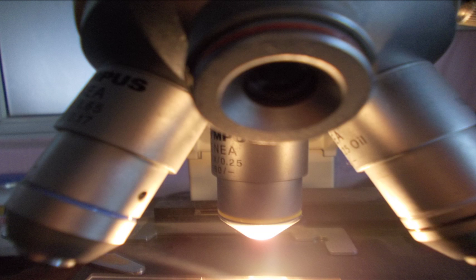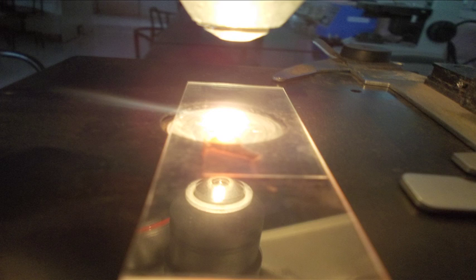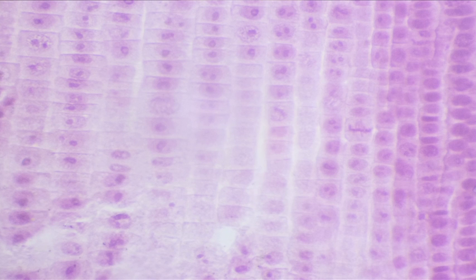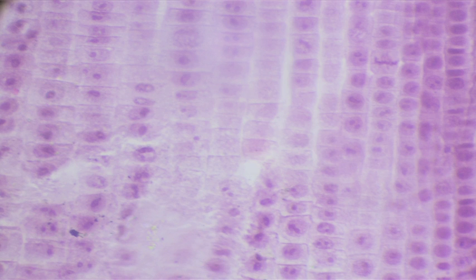Place the slide into a microscope and adjust the microscope lens to 10x and watch the results. For a clearer view, zoom the lens to 40x and you can identify all the stages of mitosis through this view.